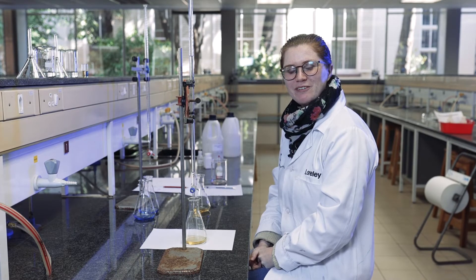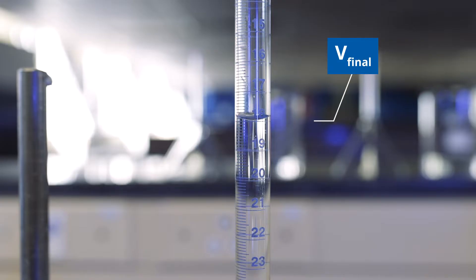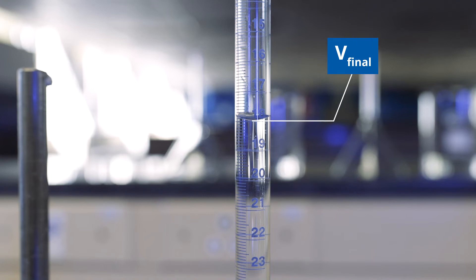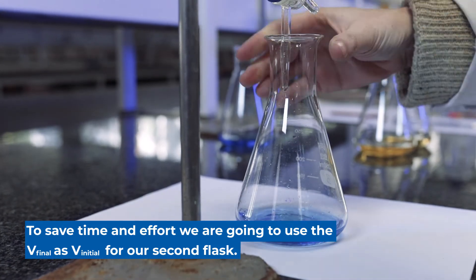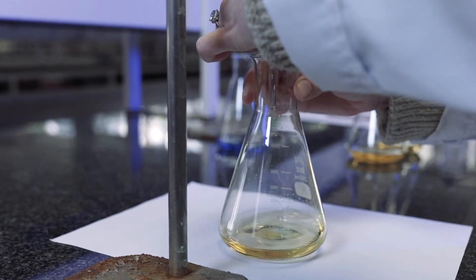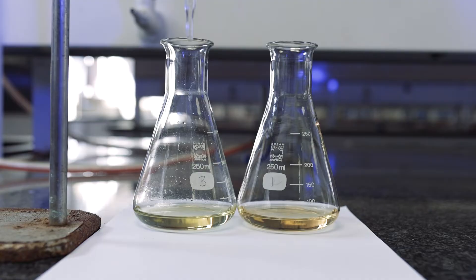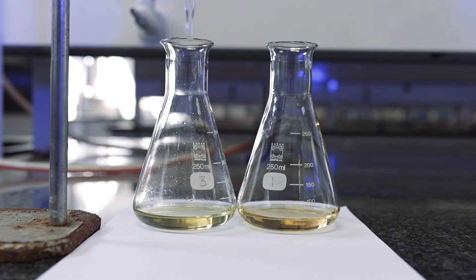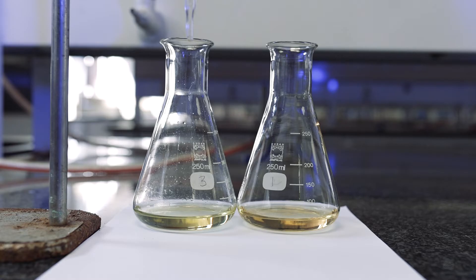Once again you can see this one is over-titrated as it's yellow. Hopefully we'll get one that's perfectly neutral. As you see in this video, one drop made all the difference. You can see that flask number three is a greener color than our first titration and it reached the endpoint perfectly.